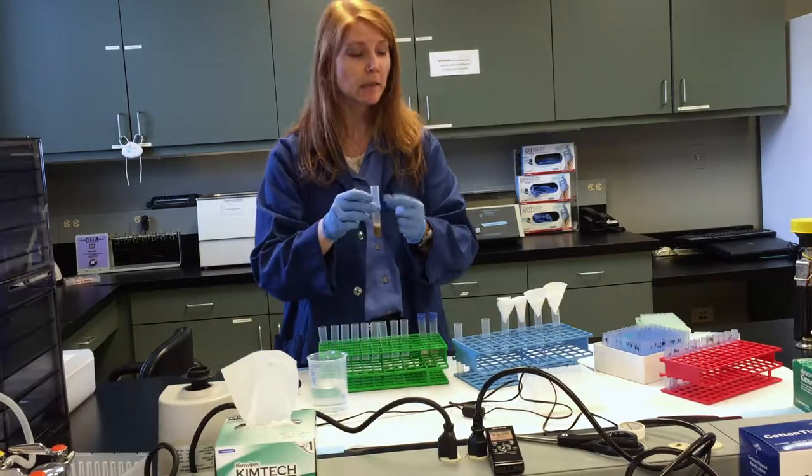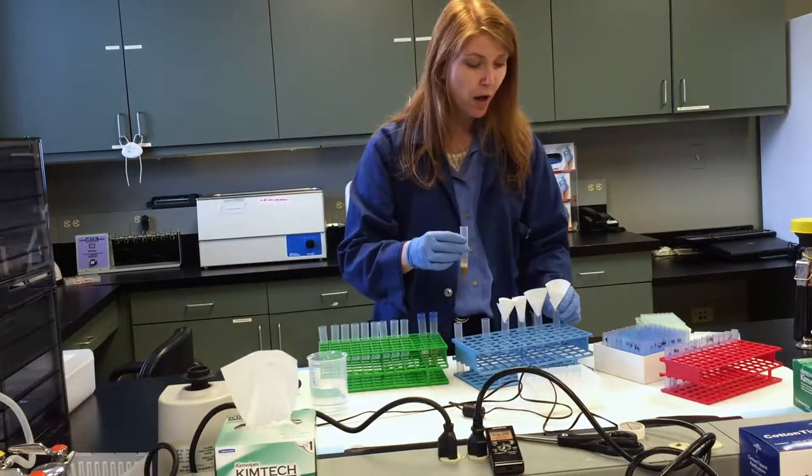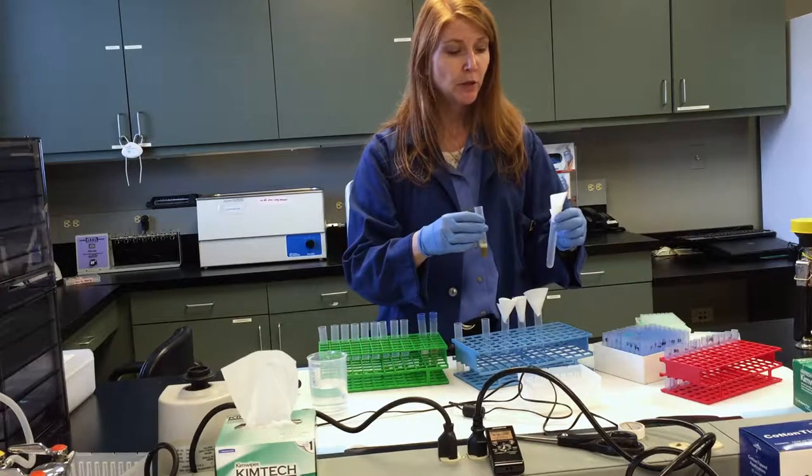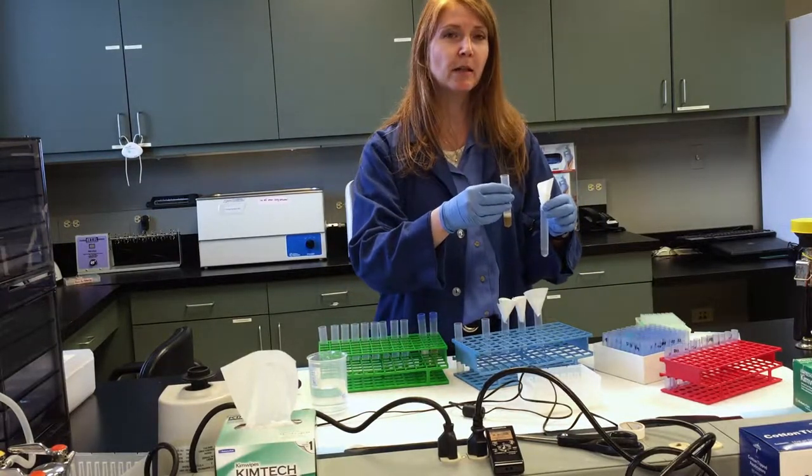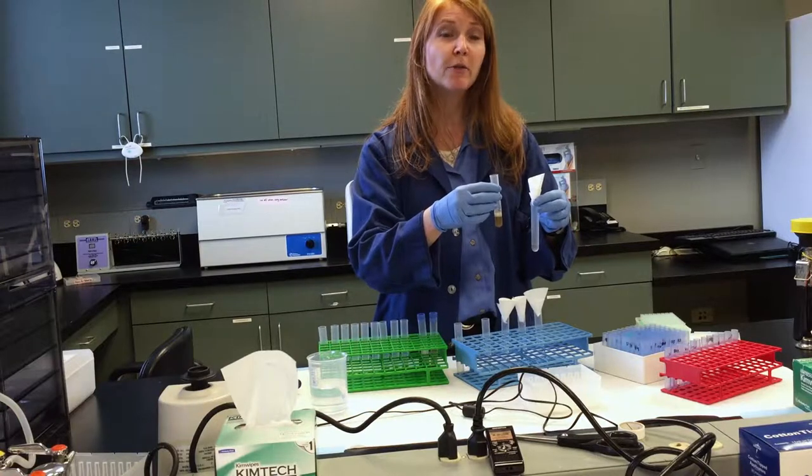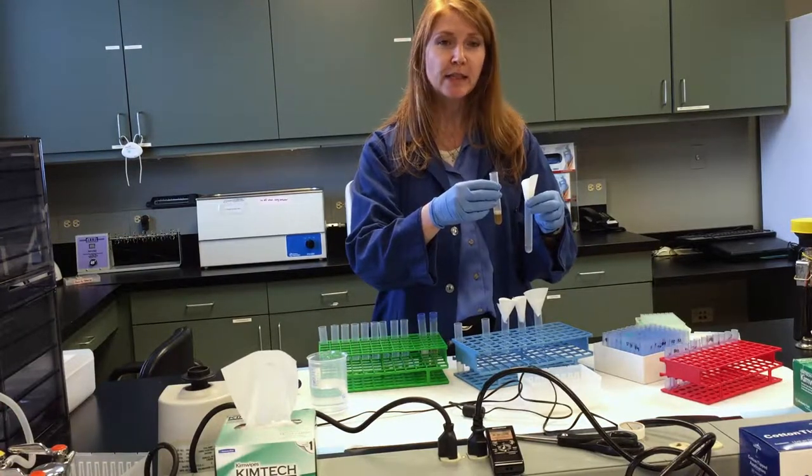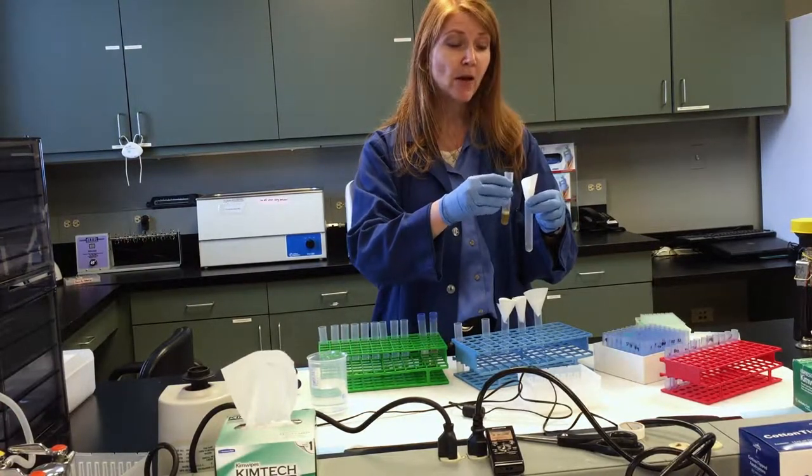Once it's been thoroughly mixed, we're going to then pour it into a filter using filter paper into a clean test tube. And this will separate the liquids from the solids because we no longer need the feces. We just need the alcohol that now contains the hormones.